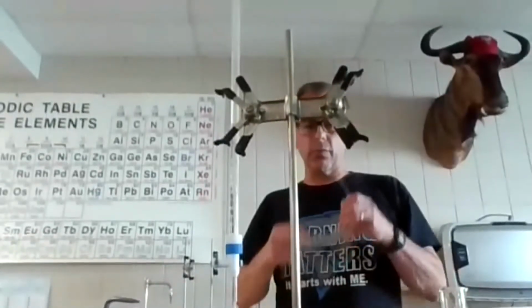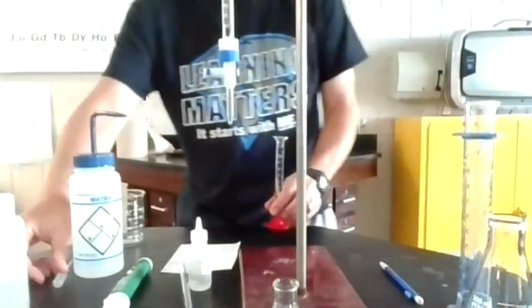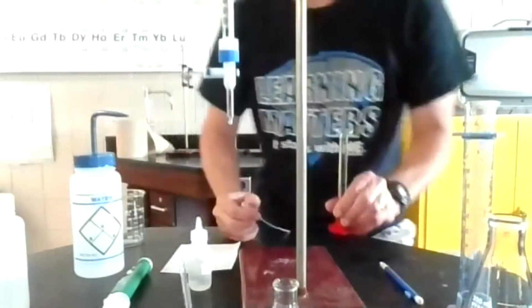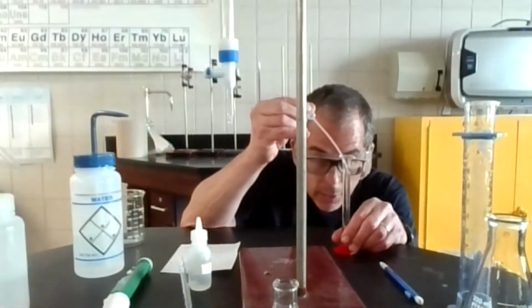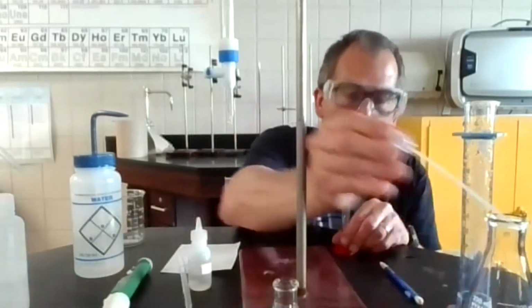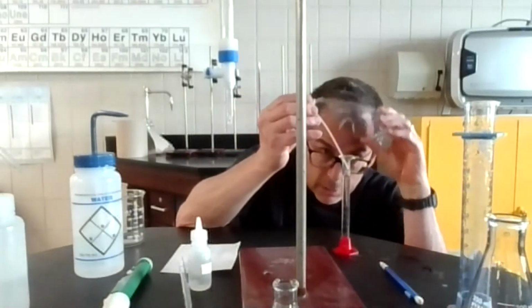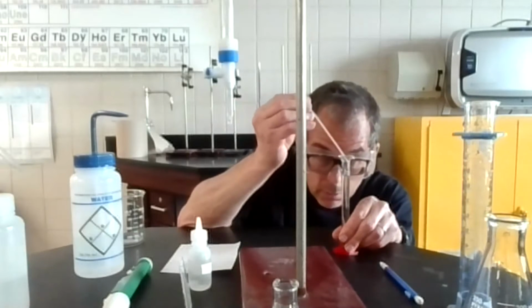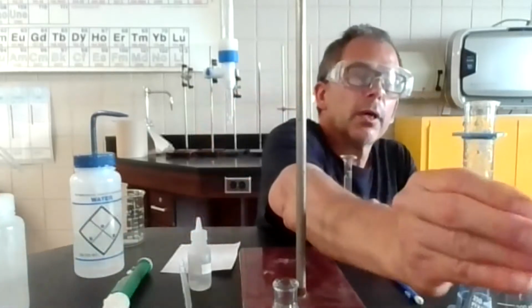Let's see, I will start with our base, I think. I'm going to get a new pipette bulb. I got 10 plus milliliters, so what I'm going to do is just draw off the liquid to get to 10. I'm going to draw off enough liquid. Seems like I need to get rid of a little bit more, to get to 10. And then, if you're worried about it, you could always save it. Whoops. I didn't want to do that. Okay, so now I'm down to 10 milliliters of this liquid.